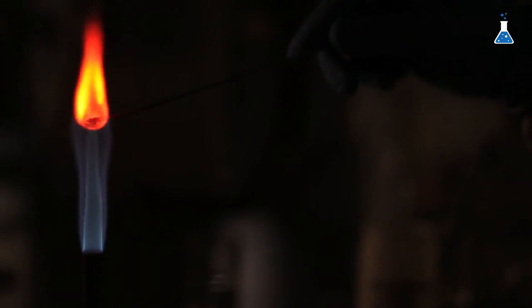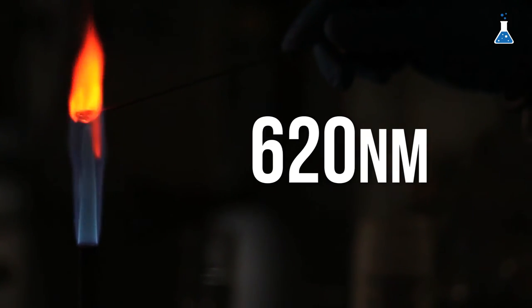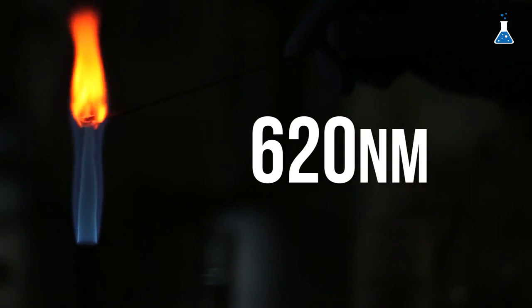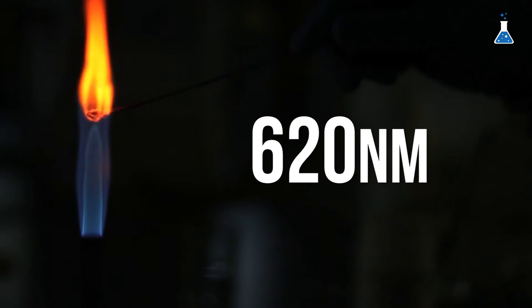The first metal we are going to see is calcium, employing calcium dichloride. This compound emits an orange-colored flame that corresponds to a wavelength around 620 nanometers.